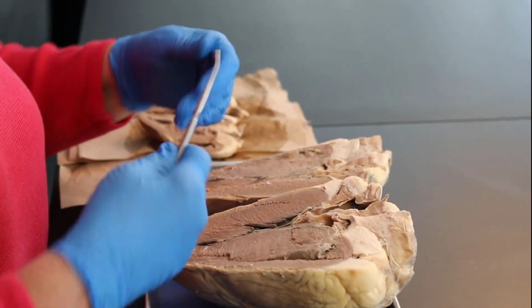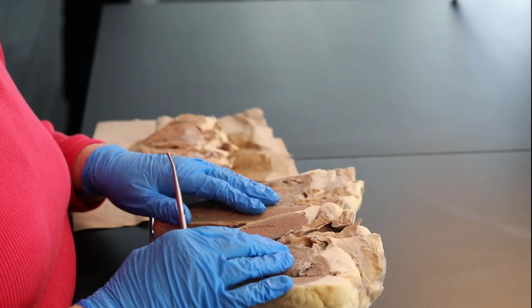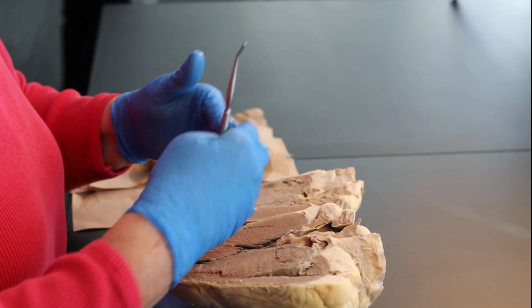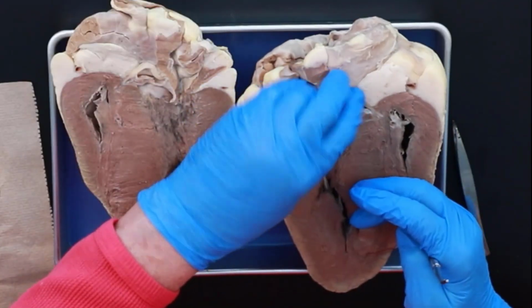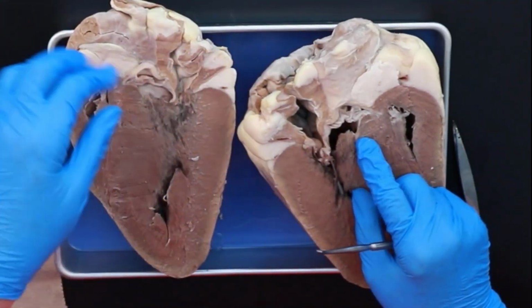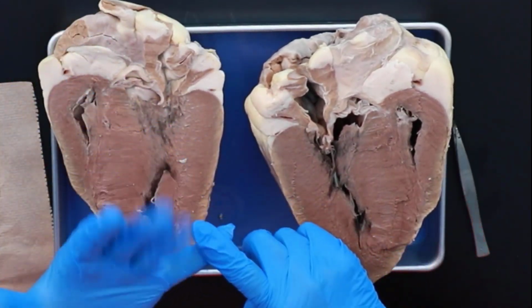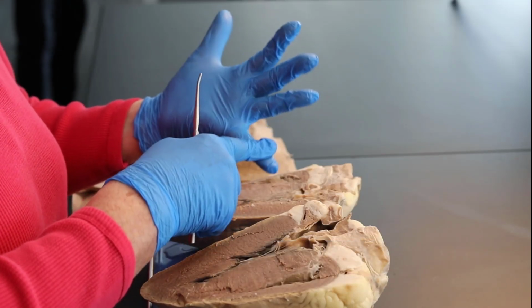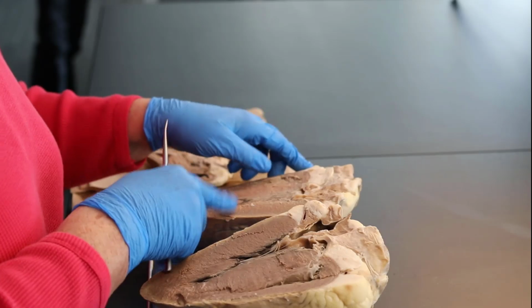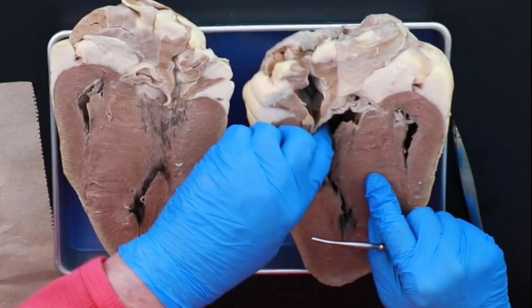Now, the other two valves are semilunar valves. These prevent the blood from backflowing back into the heart once it's been pushed out. And they are called semilunar valves because they look like little half moons. I've got a part of one right here, and I've got a part of one right here.